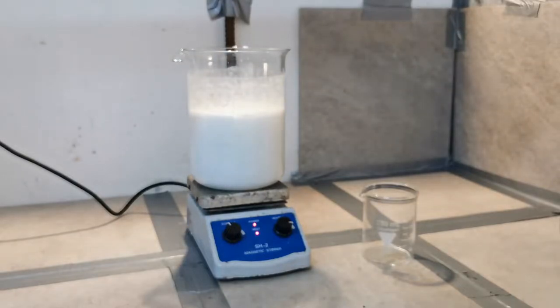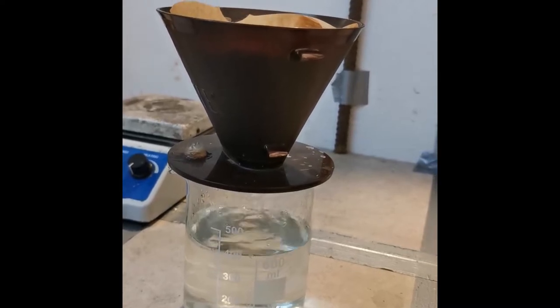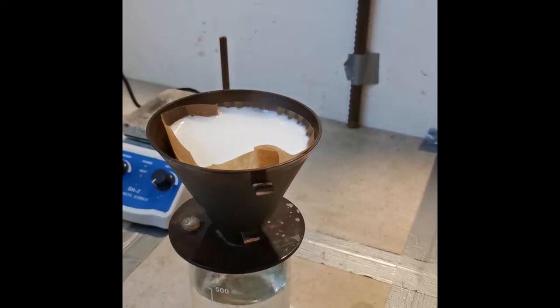Whilst this is happening, the pH might become acidic again. So test it before you are done and add more carbonate if necessary. Now I filtered all of this through a coffee filter. Then I washed it a few times with distilled water to make sure all of the sodium chloride is gone.